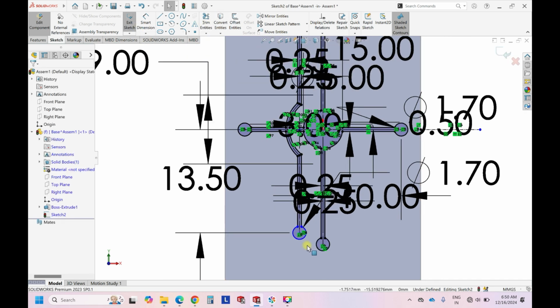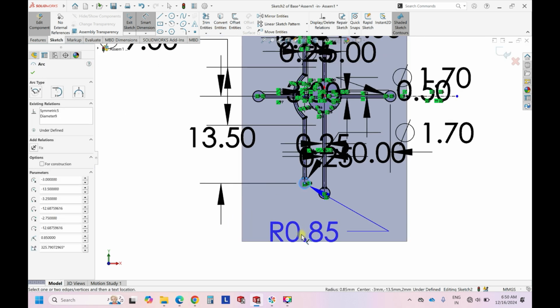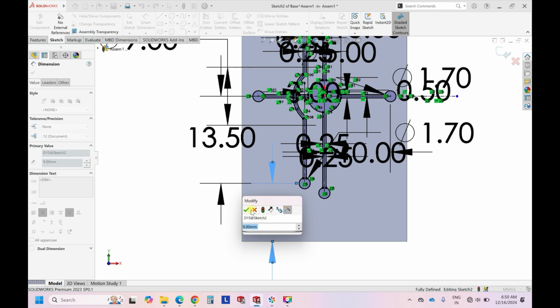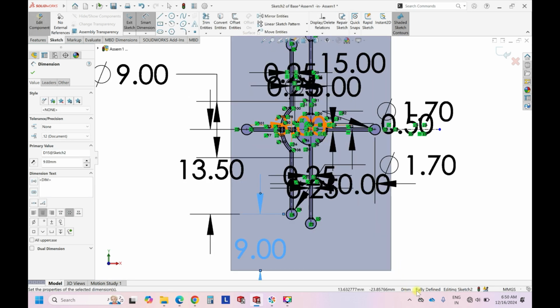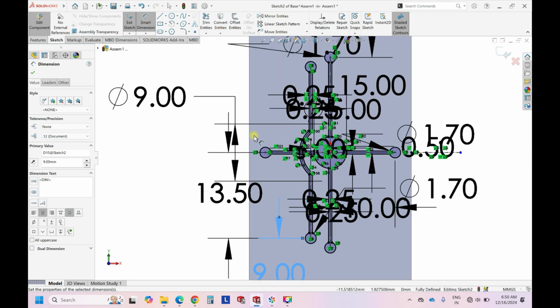So these two circles are in blue because they are not being given constraints from any side of the chip. So for example, I am just constraining it. So see, with one constraint it turned black and it is again fully defined. Okay, so now the same design you can just mirror it.